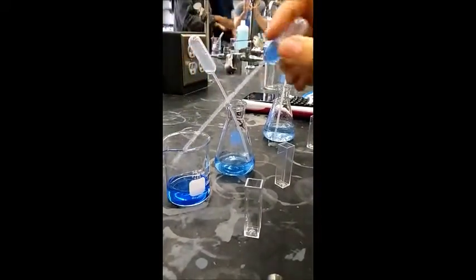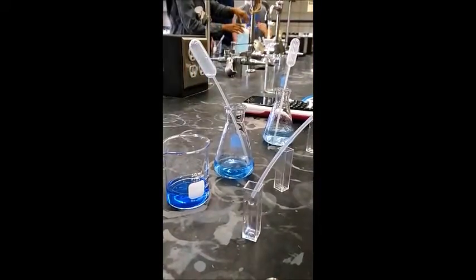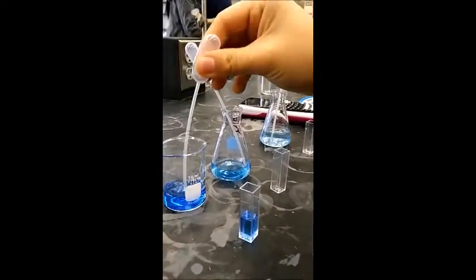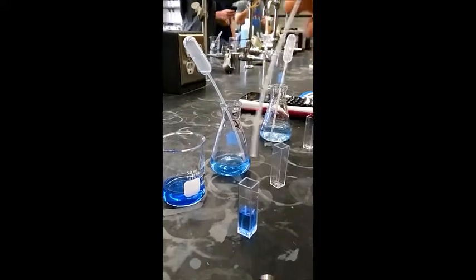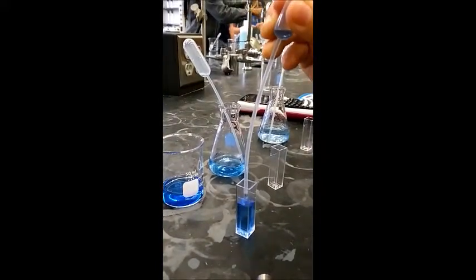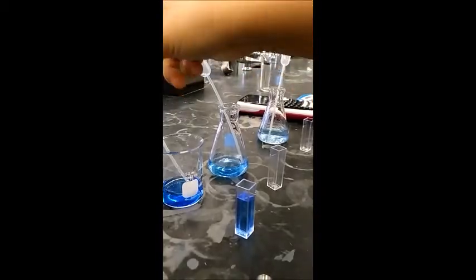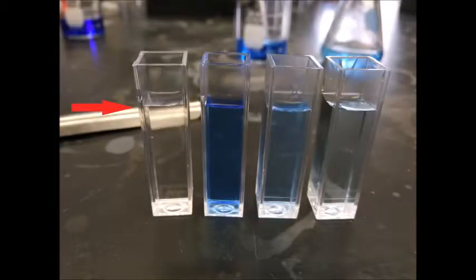By this point of the lab, all dilutions should be completed, so the next step is to transfer sufficient but not excess solution to the cuvettes using plastic pipettes. Make sure to create a cuvette for each dilution as well as a blank to zero the machine. Each cuvette should be filled to the faint line as shown. Once each cuvette is prepared, head to room 360 in order to use the spectrophotometer.